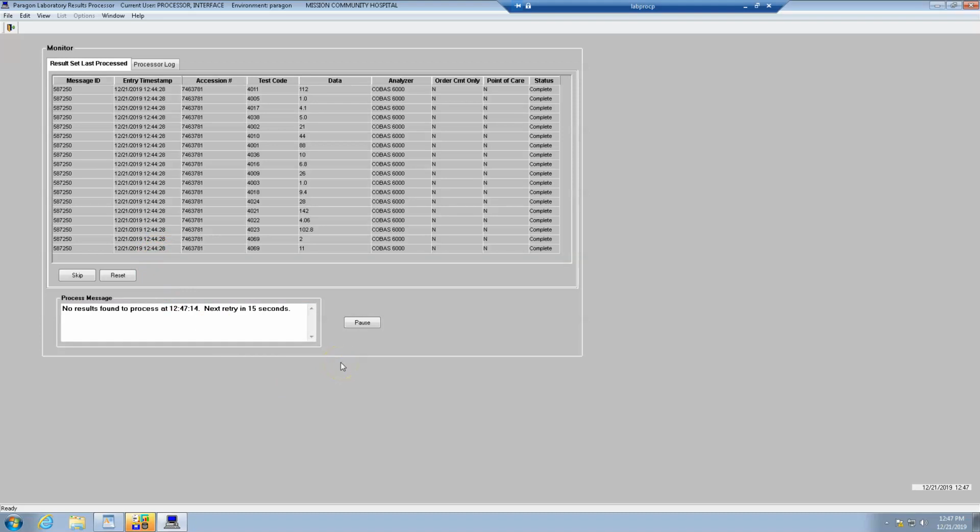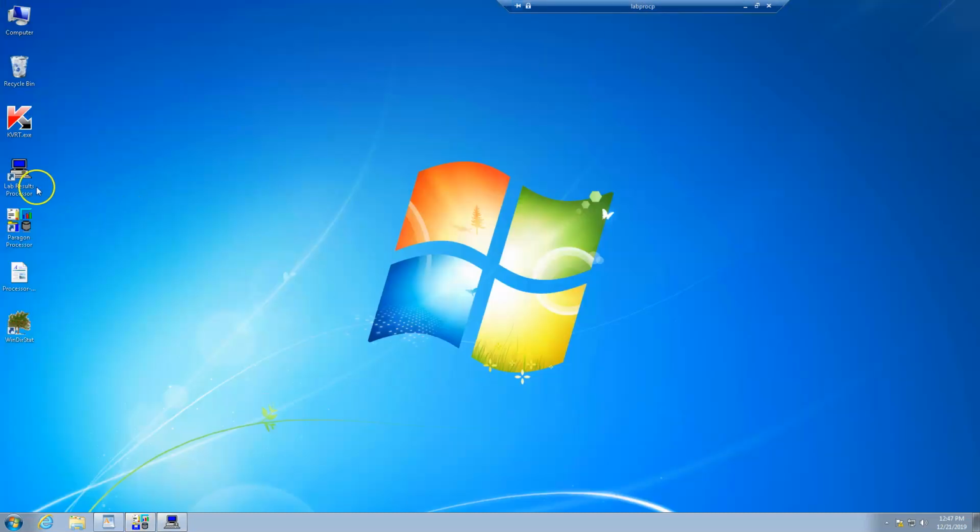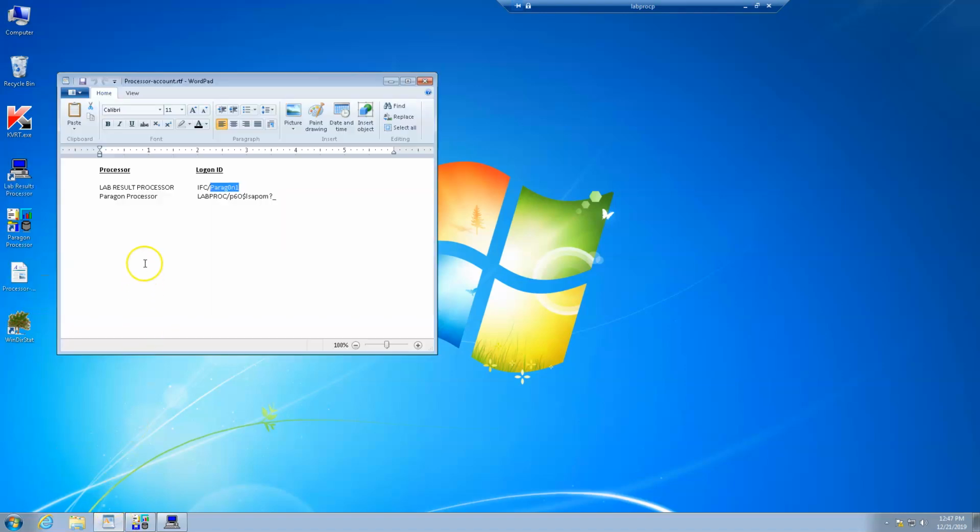Let's say I log in, right? It's 2 in the morning, the lab associate says the results aren't processing. I've restarted my DI interface. I've restarted my N tier interface, and I go here and I see that nothing's happening. Okay, so it's 2 o'clock, the last result I have was, let's say, at midnight. The best thing to do is to hit pause, which will close this application, and then reopen it from the desktop. Okay, with the LabProc credentials. I can't stress that enough. Or at least I think it's the LabProc. I'm sorry, no, with the IFC credentials. Okay, that's for the lab results processor.